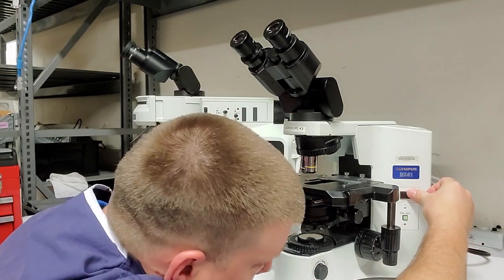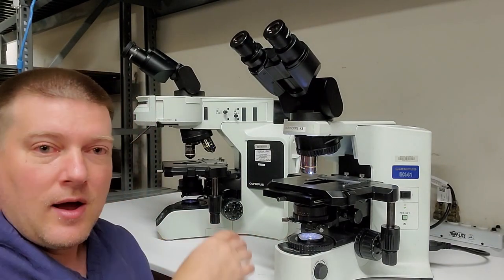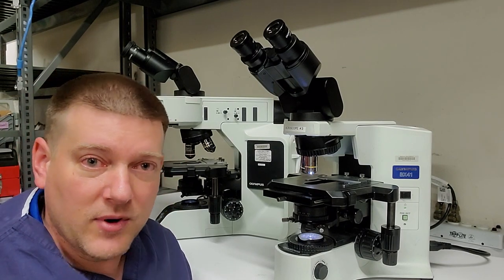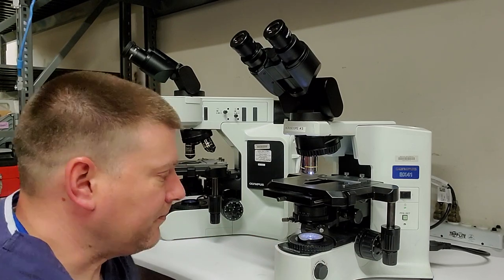Here, let's go ahead and turn this guy on, maybe get you guys a better view. So these guys here, you can see they're pretty dirty, and we're going to get into that in just a minute. I'm going to show you guys how to tear some of these down, and we're going to clean them real quick. Just a very generic PM, okay?